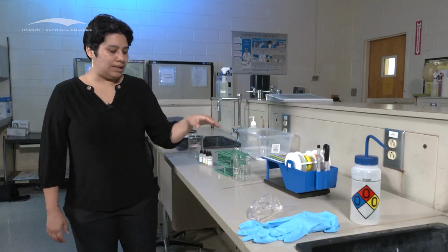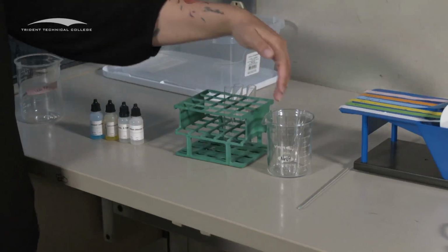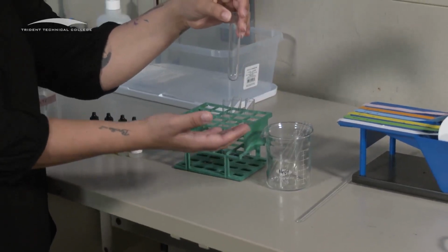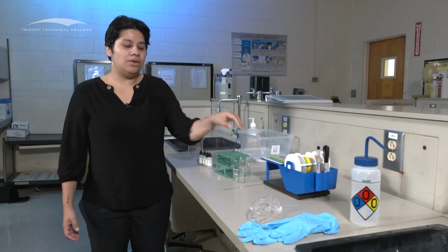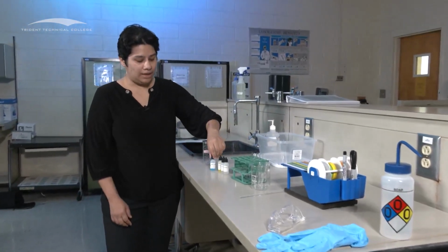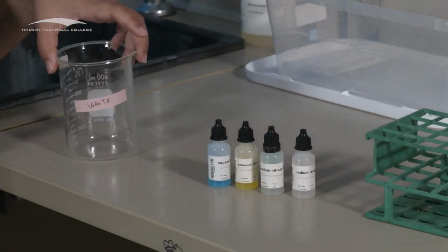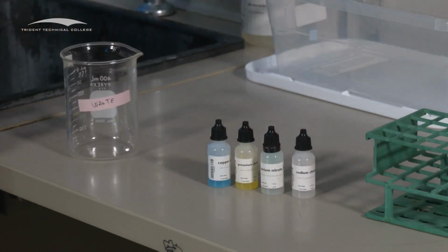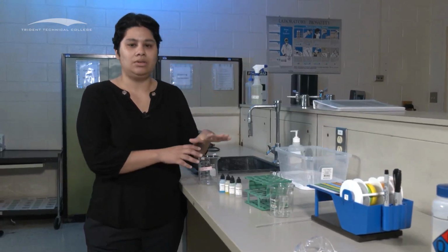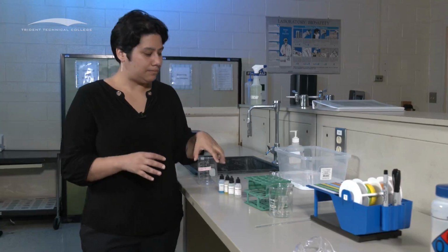And then you're either going to need a test tube rack or a 250 milliliter beaker, depending on what is available to you. And of course you're going to need 6 test tubes, and this is the size that you are going to need. You also need your 4 solutions, and they're all labeled. Please double check the name of them before you use them. And then you need a waste container. One will be provided for you in the fume hood as a large container. If not, please make your own little waste container, and then we will consolidate them all together.